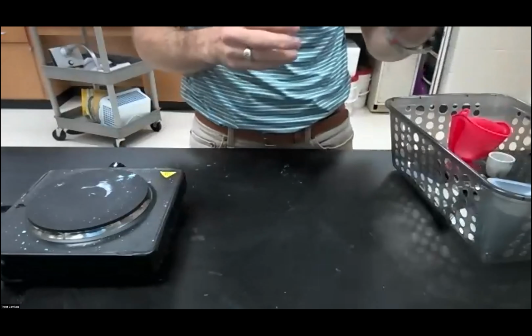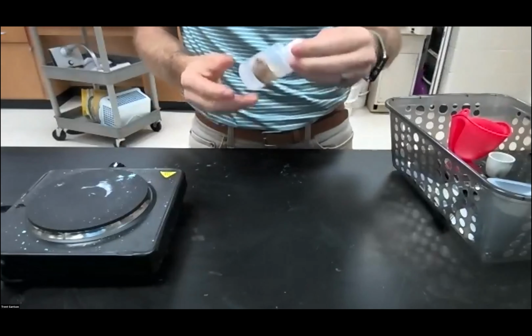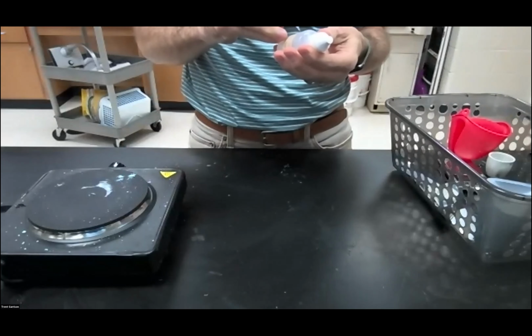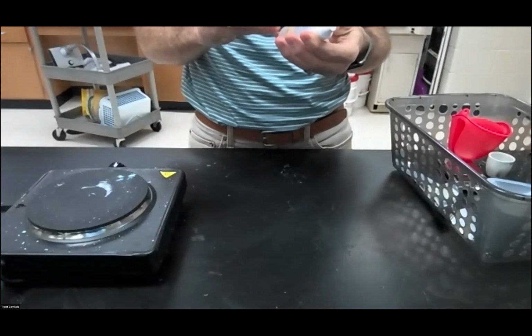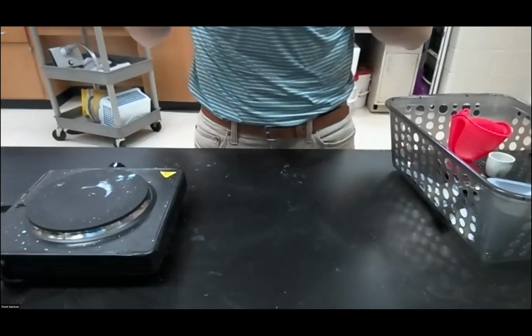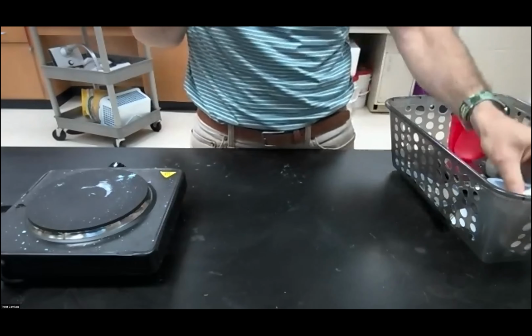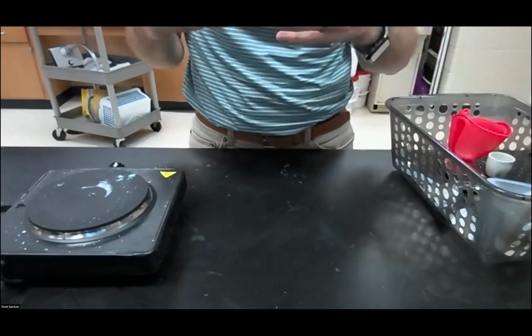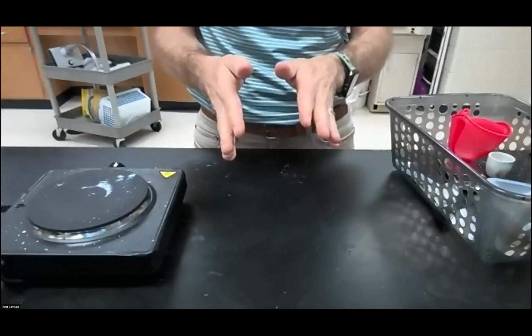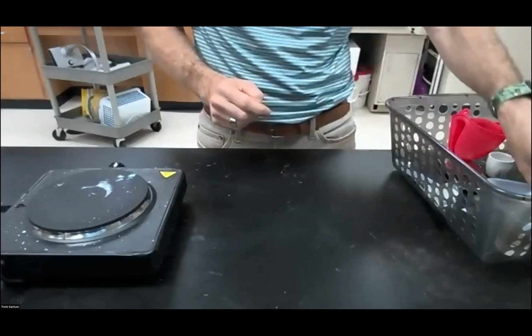with. So we are working with an acid. It is HCl, hydrochloric acid, and it is 6 molar, I think. Maybe it's 3 molar. It's very strong. It's 6 molar. What that means is that it would cause damage to the eyes. It would cause damage to the skin if it gets on there. If you get it on you, please make sure that you wash it off.